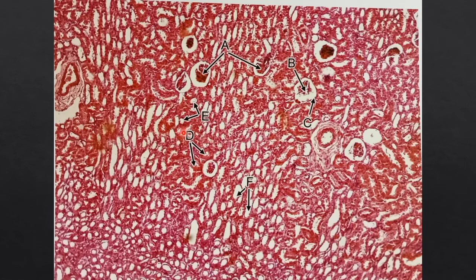These are nothing but the tubules. Here you can see a tubule. So presence of these tubules: proximal convoluted tubule, distal convoluted tubule. This is nothing but the Bowman's capsule, and the glomerulus, a tuft of capillaries. So presence of the proximal convoluted tubule, which is dark stained, and distal convoluted tubule, which is light stained, and the presence of Bowman's capsule with the tuft of capillaries. That is how we have to write the identification points of the kidney.